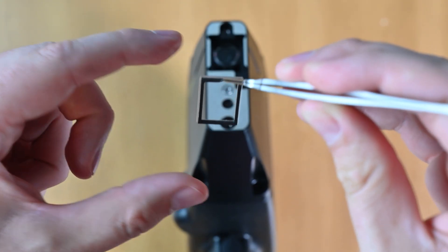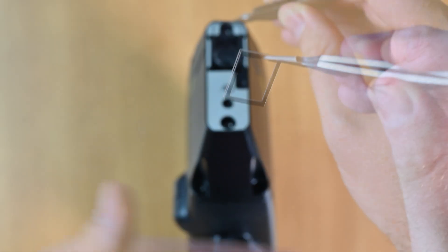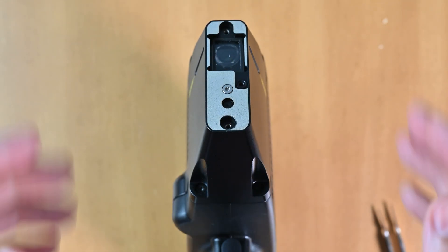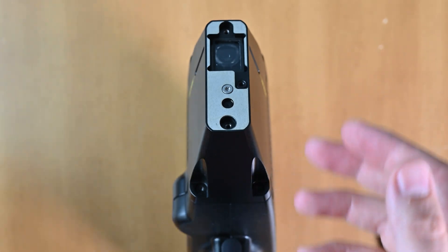If this blast shield here has residue on it, replace it with a new one. So I'm going to place this right back in the analyzer here like that. And that's it. Now your analyzer has been cleaned.